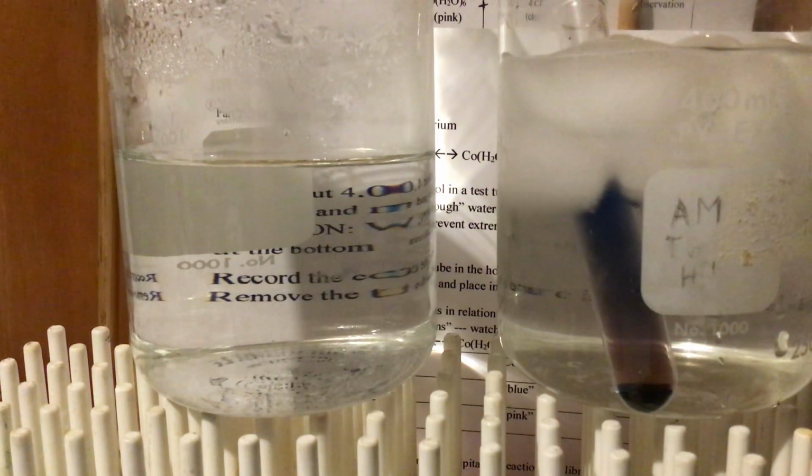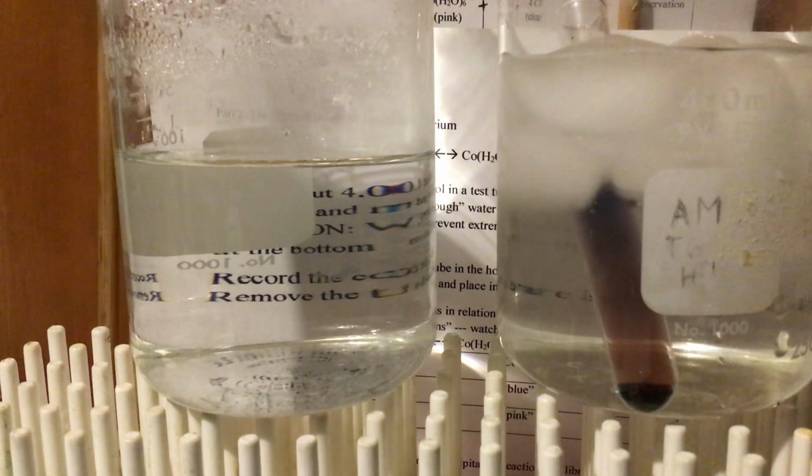So when I put it in the hot bath, it turned really a dark blue. I'm putting it in the ice bath. Oh, daybreak. Looks like it's getting a little lighter. And it takes a little bit of time for those molecules. Again, there's collisions between the hot molecules and cold molecules, and eventually enough of them bump and you get that temperature to start changing in there and start getting that color change right in there.